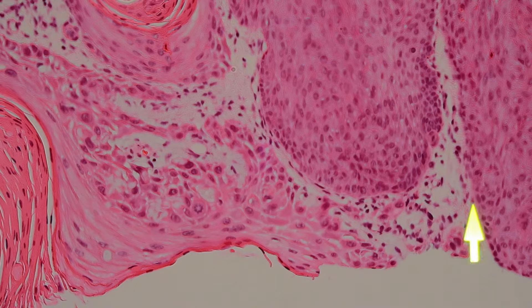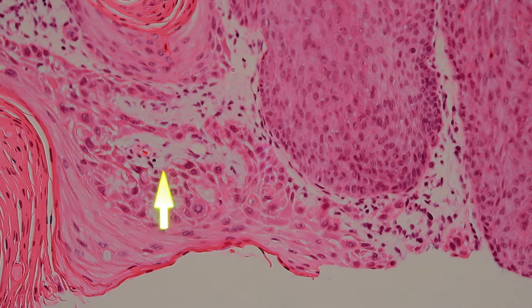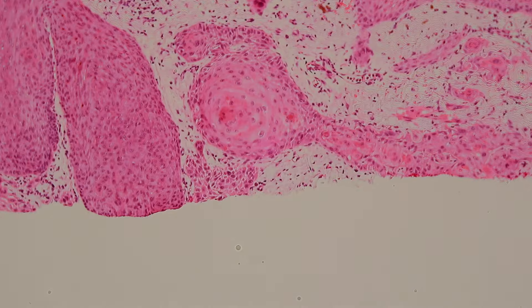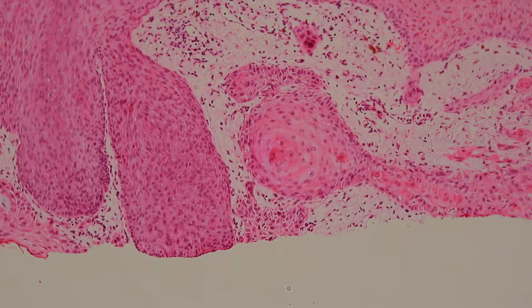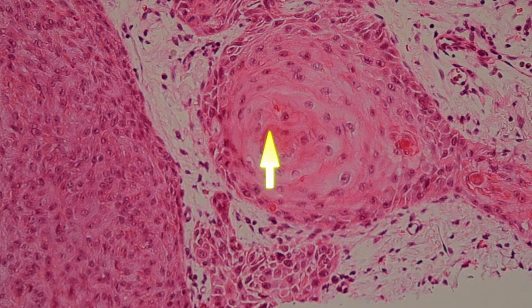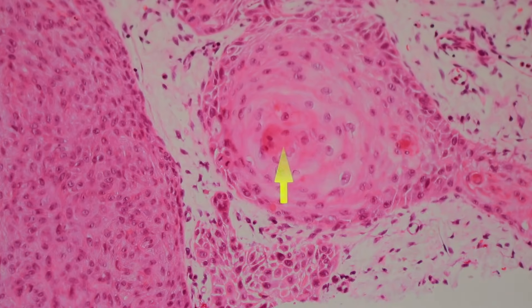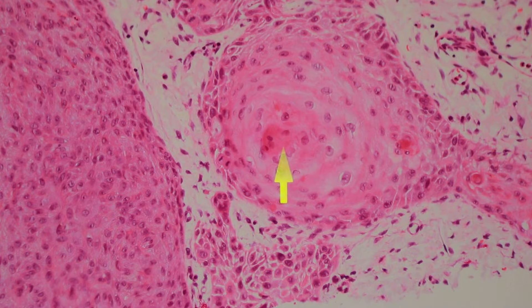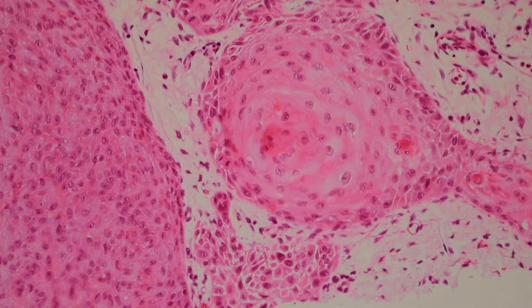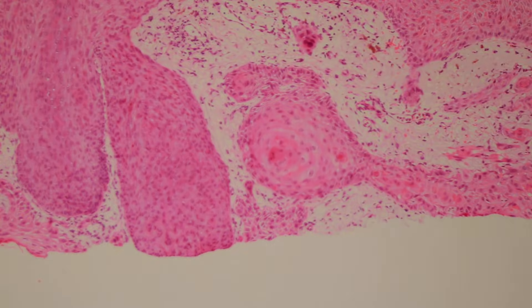Like down here, we've got atypical keratinocytes. So that, in contrast, is a keratin pearl. And sometimes when they're just starting out, they look kind of like this — that is just the very beginning of a keratin pearl, it's starting to swirl around. That's just the very beginning of a little keratin pearl in this squamous cell carcinoma.